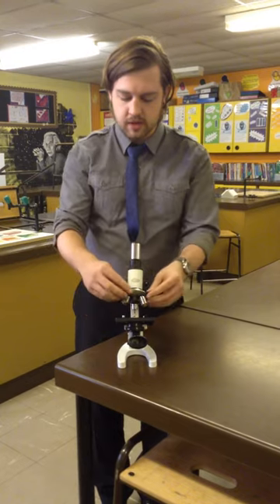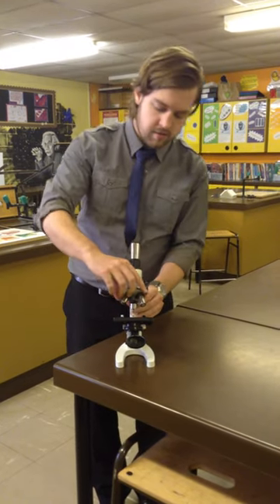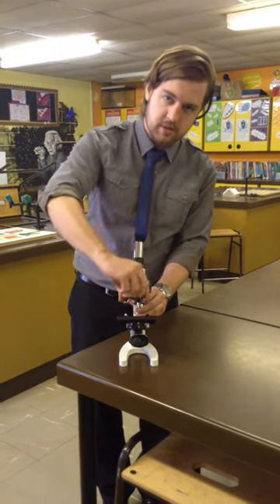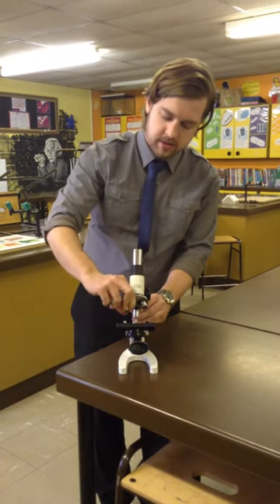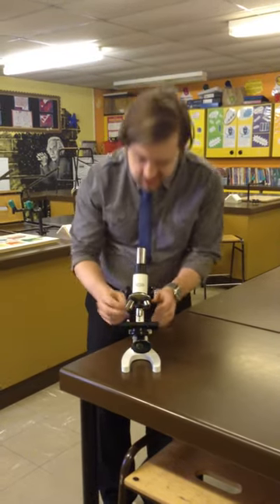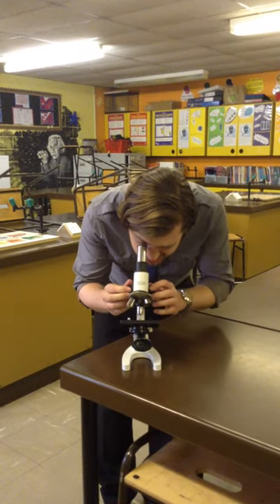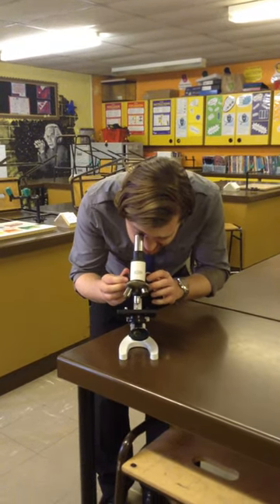Once you get it into focus you can then alter the lenses. Remember to hold on to the arm of the microscope so it doesn't go flying when you turn the lenses. When you turn them over they'll make a nice little click noise so they're in place and then you might have to adjust the focus a little bit more just to get it back in.